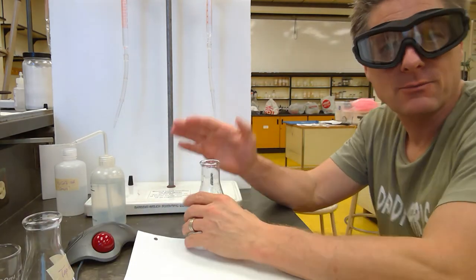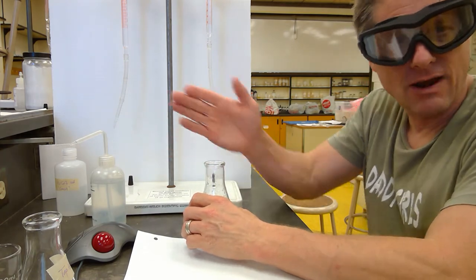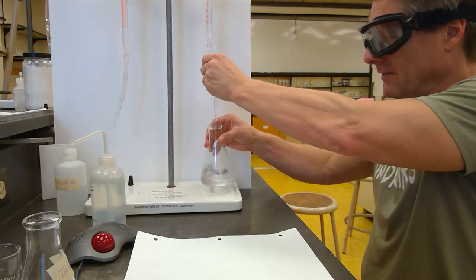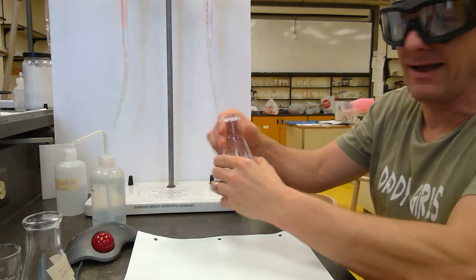I know in introductory chemistry, we use a pH chart with a little, you know, at this pH, it's this color pink, and you try to match the pink color. Whatever works for you, but don't try to just look at it because you can play mind games with yourself. All right, so I'm going to add another drop. Woo, that was one drop, guys.